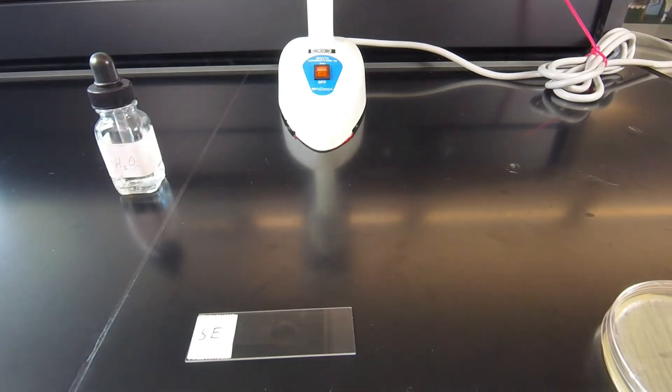So now we have the water on the slide, we're going to remove some bacteria from our petri plate. We would sterilize the loop as we always do, and then we're going to stick it in the edge of the agar to cool.